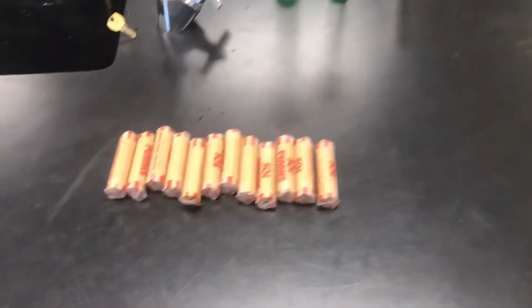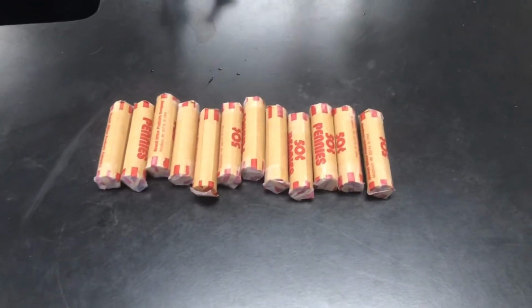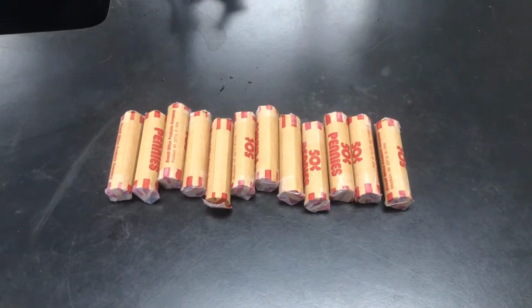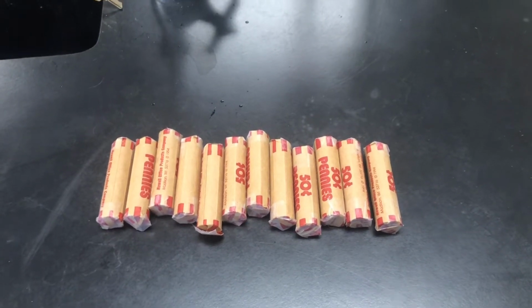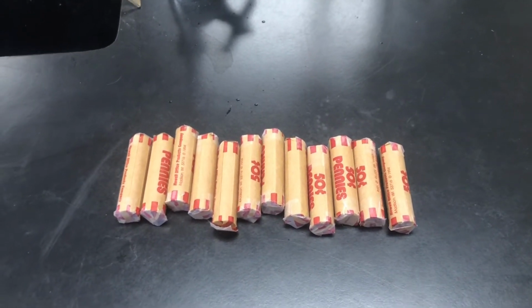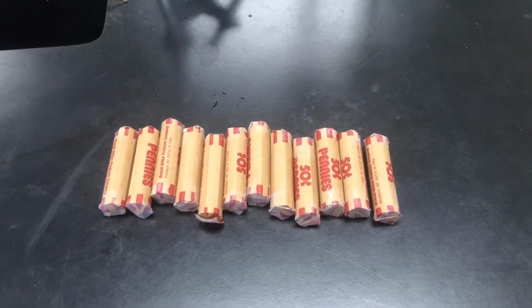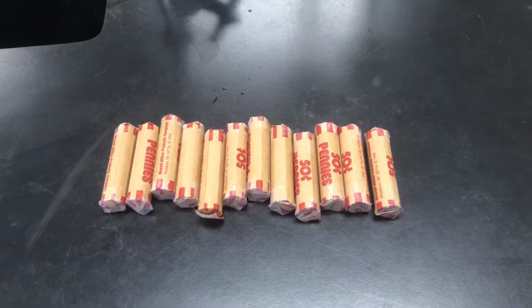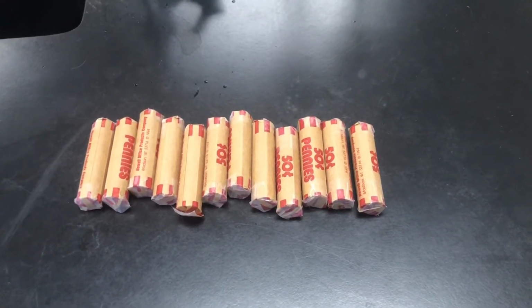So here we go, guys. In this activity, we've got to figure out which year, based on the data of pennies, did the U.S. Mint change the composition of the penny? It costs money to put together this copper and this other metal that is in your lab. So we're going to take these pennies apart and start figuring out how to do this. I'm your lab partner today, so here we go.